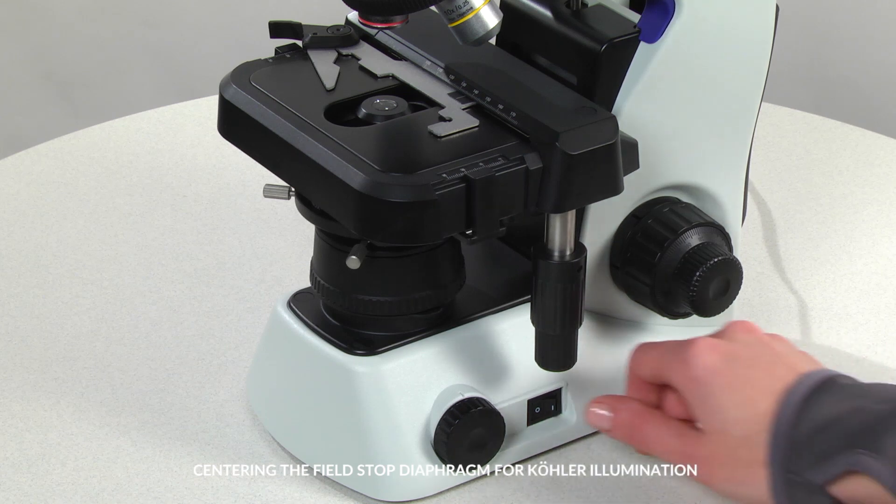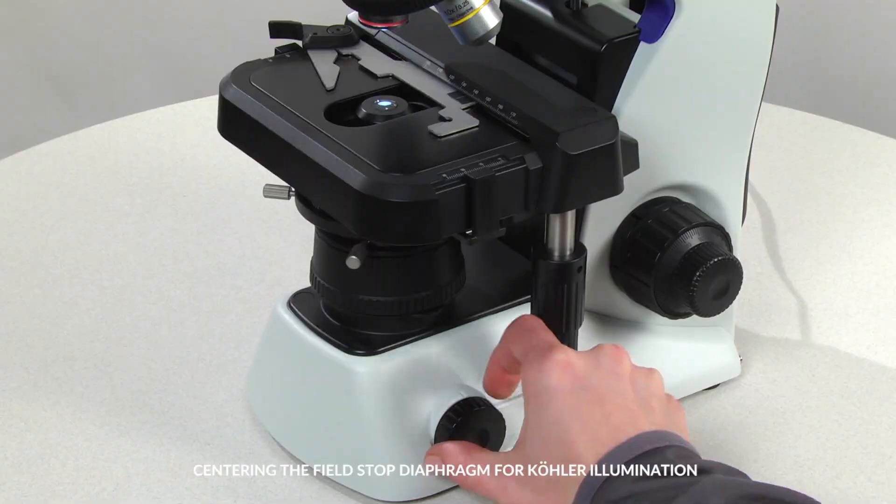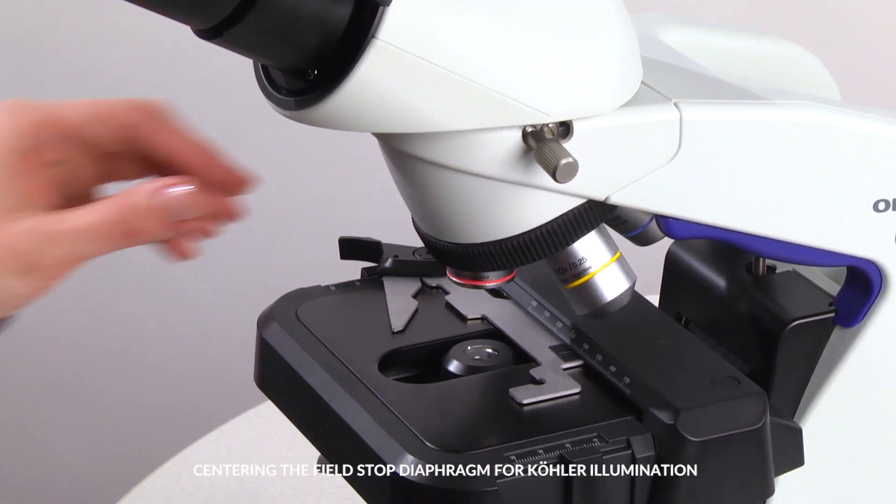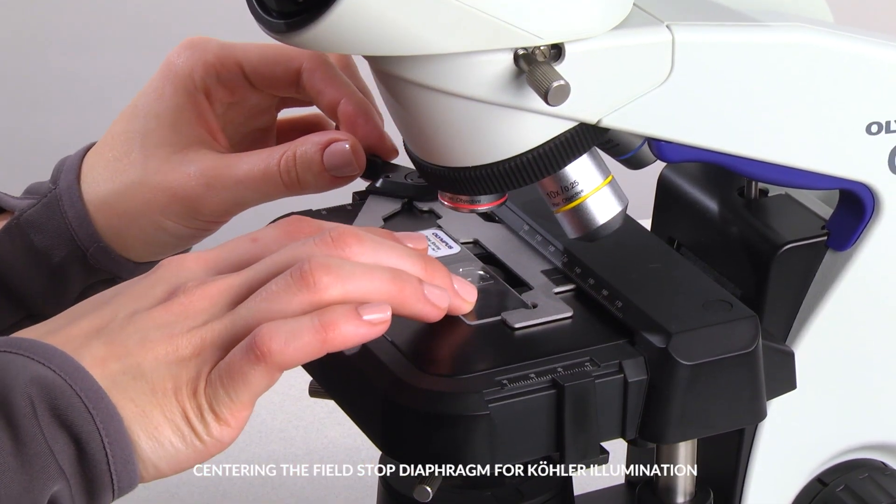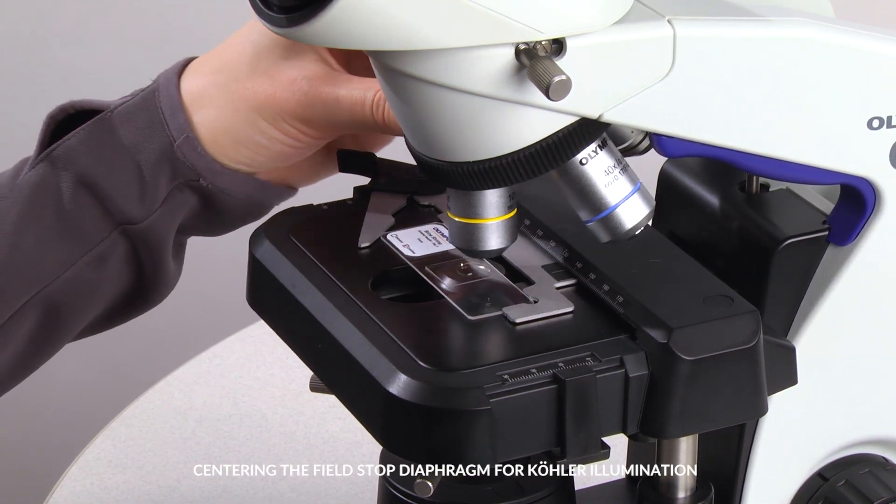To center the field diaphragm, turn on the LED illumination, place a specimen on the stage, engage the 10x objective in the light path, and bring the specimen into focus.